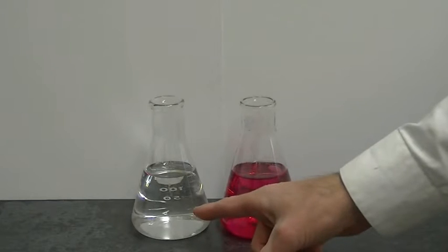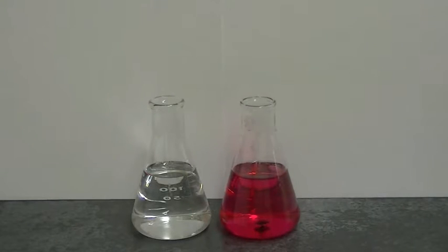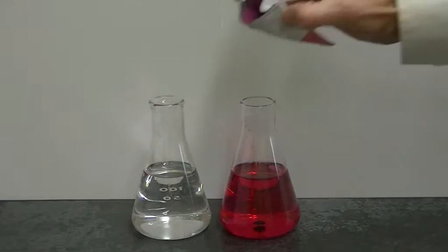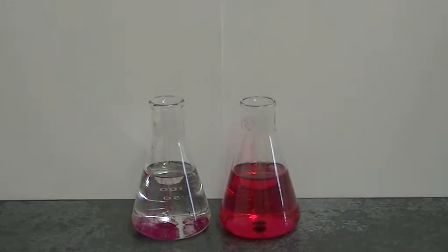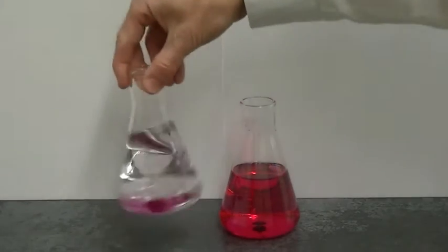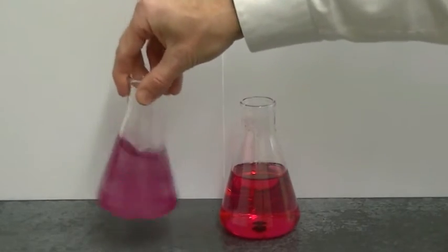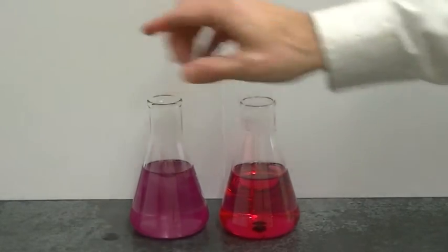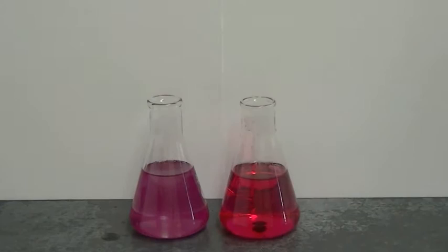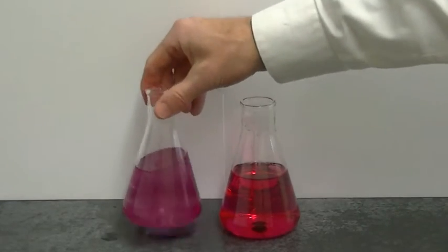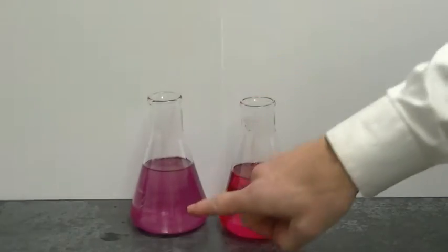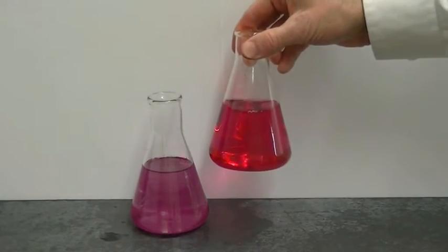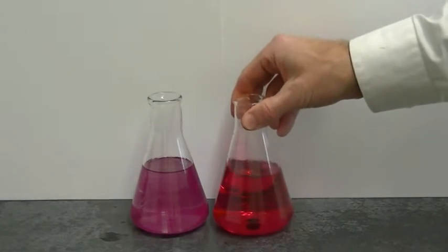Let's try the same thing in some isopropyl alcohol. Now isopropyl alcohol is fairly non-polar, and so I would expect betanin not to be able to dissolve as well in the non-polar isopropyl alcohol, and indeed that's what's observed. I can see some particles that have been dispersed throughout the alcohol giving it a red color, but those are large particles. We can see that those are not dissolving well because the light is not passing through this, whereas in this case light does pass through because it is indeed a solution that's been made.